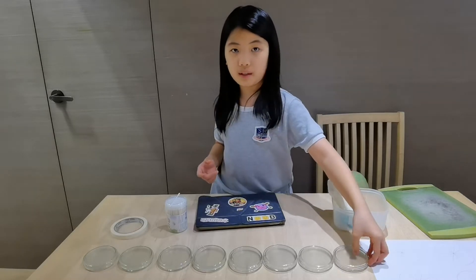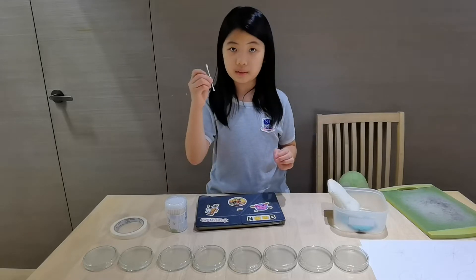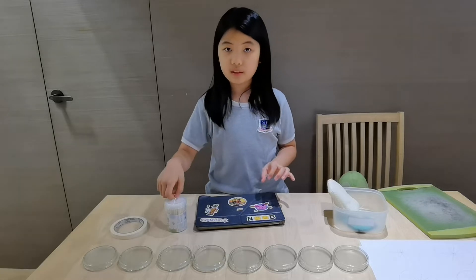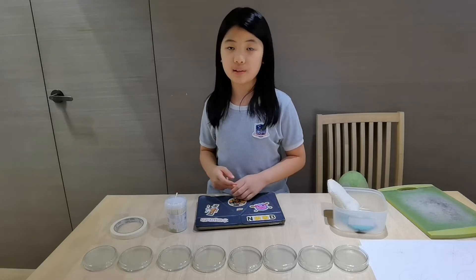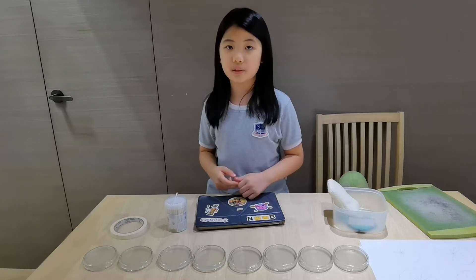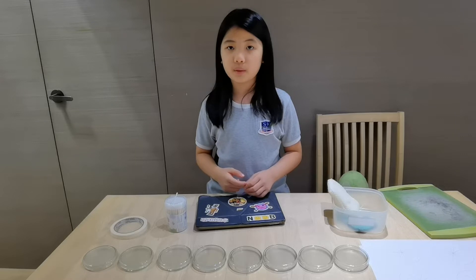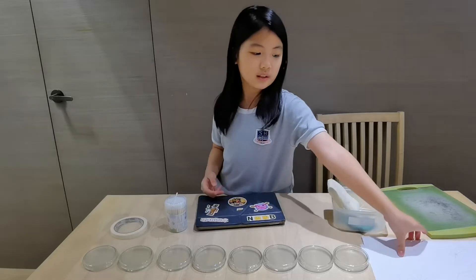So I will take a cotton bud and swab it onto the test subjects before carefully smearing it onto the petri dish. To standardize the results amongst the dishes, I will swab on every one of them with the same snowflake shape.